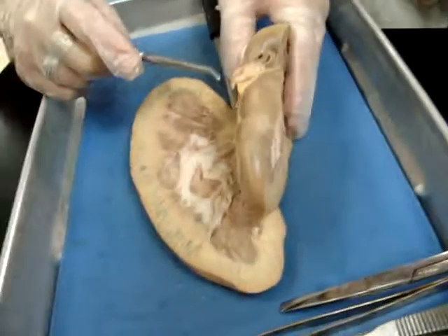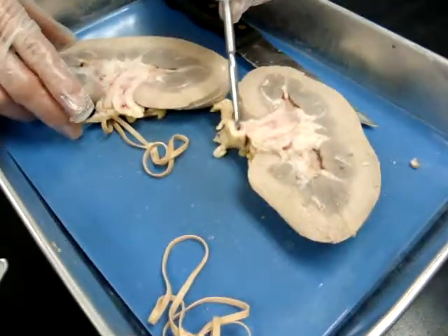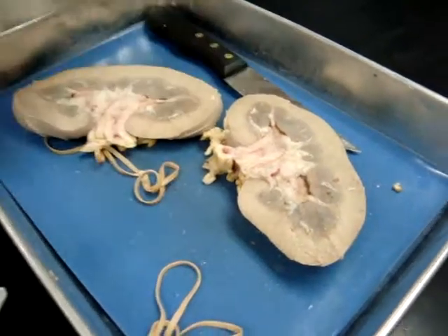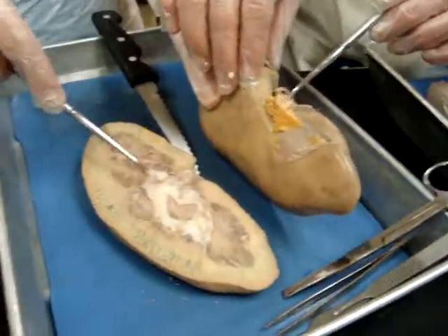Is that the ureter? That's the ureter there on this one. Can you point to the vein and artery? We've got a better one here. Here's the artery. Here's the vein.